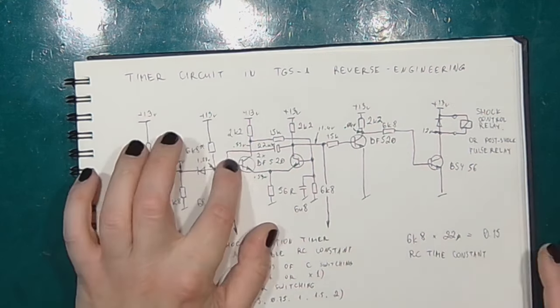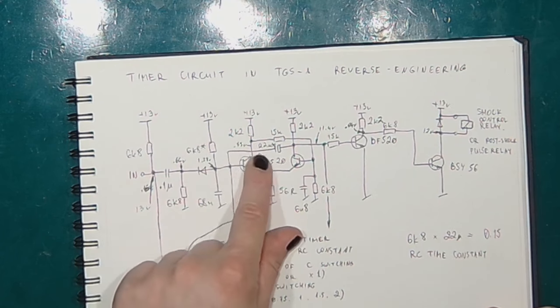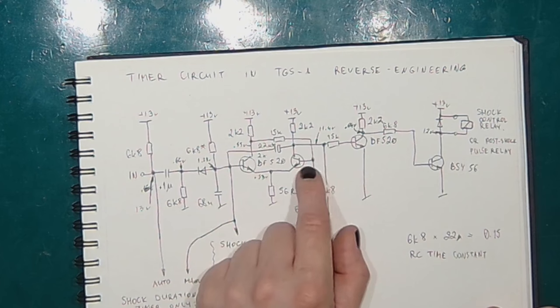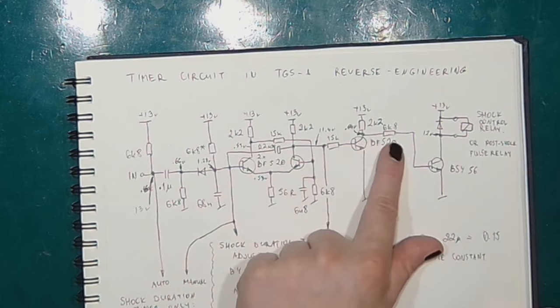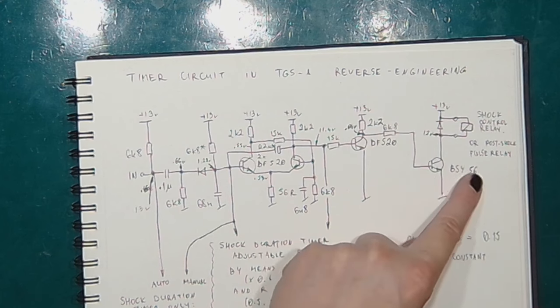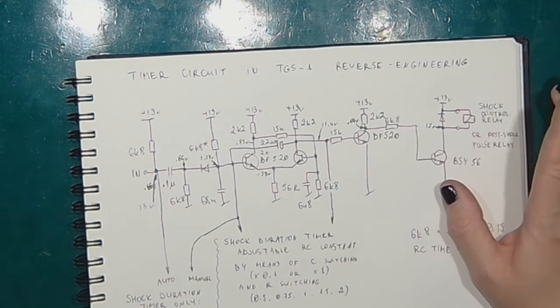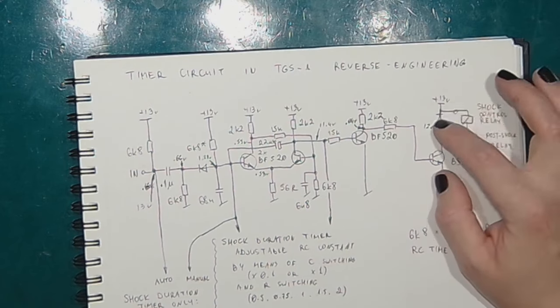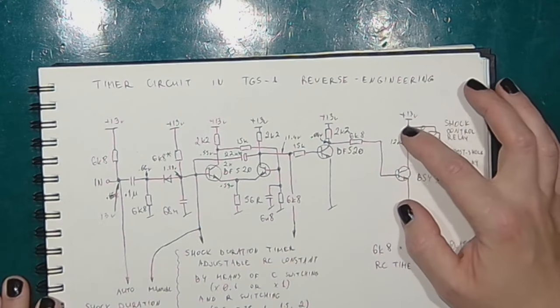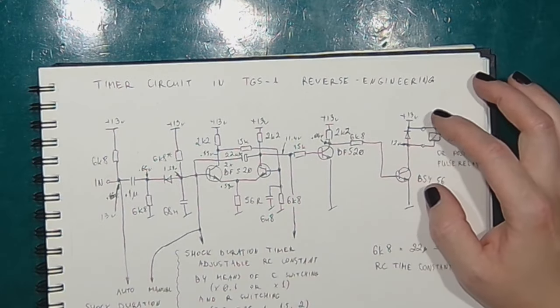And when this base goes high again, the transistor will start conducting. This goes low, and the other base also goes low, so the collector goes high. This will conduct again, pulling the collector down, and the final transistor will stop conducting, so the relay will go off. And this is the flyback diode preventing the self-induction electromotive force from damaging any part of the circuit.